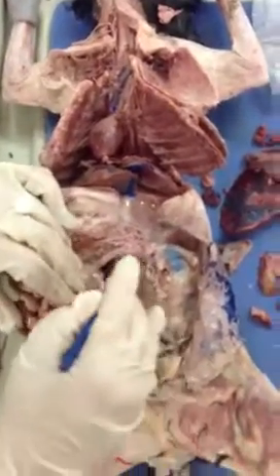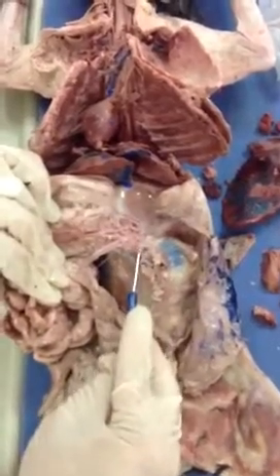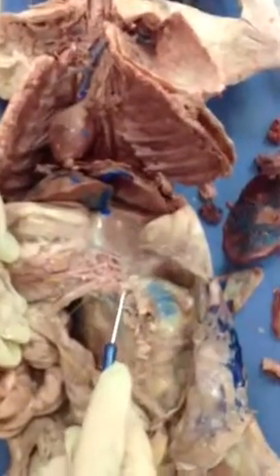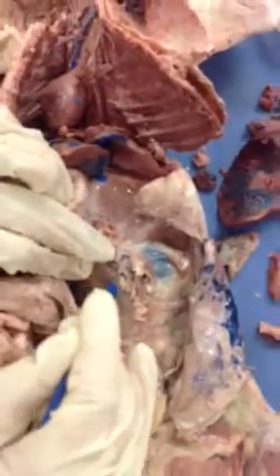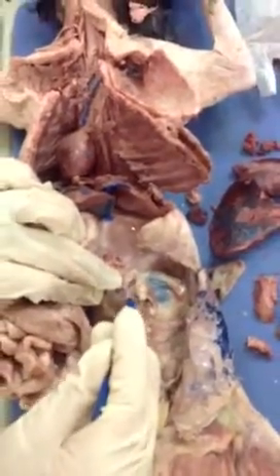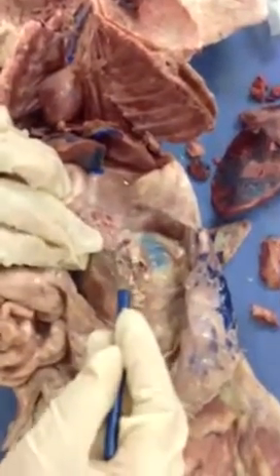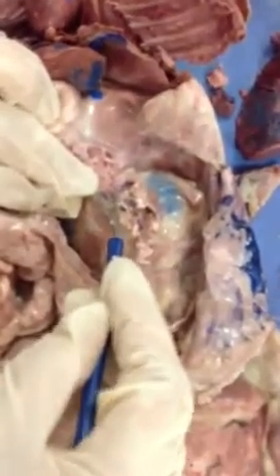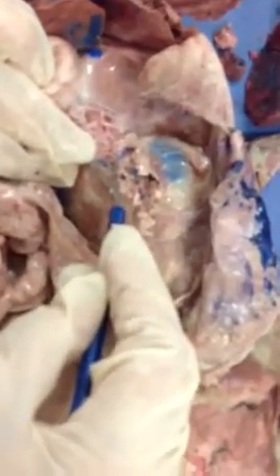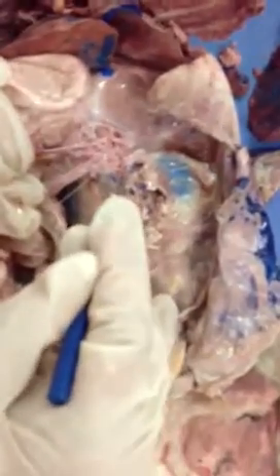Now, the next branch, please. Adrenal lumbar. Now, this is my adrenal gland. You see this little portion here? It's very small, and it has a very small caliber artery that is called the adrenal lumbar. You see the vein clearly. You see here the vein, how it's going into the small gland? Right. The artery is here also. You see how small it is? This little thing here. Okay.